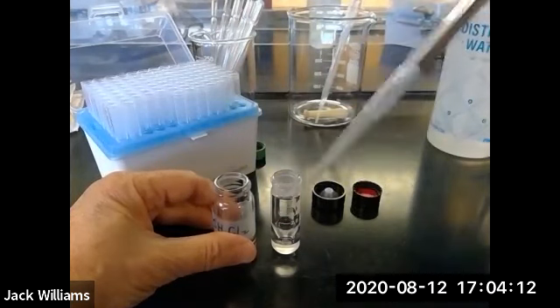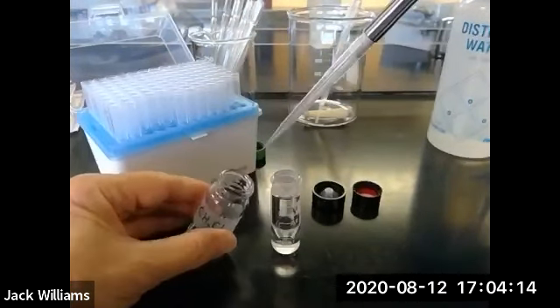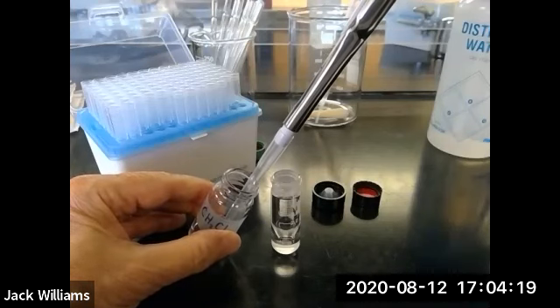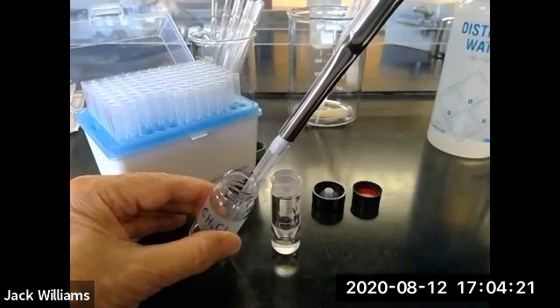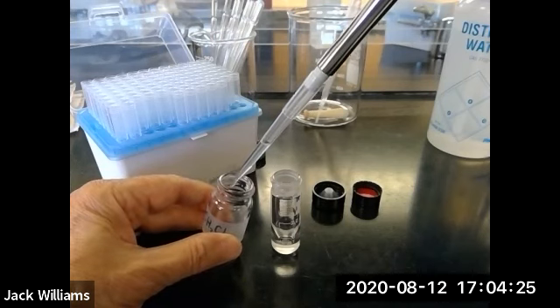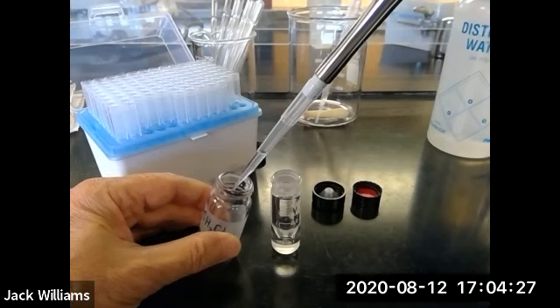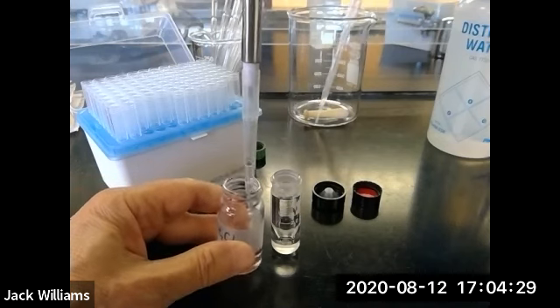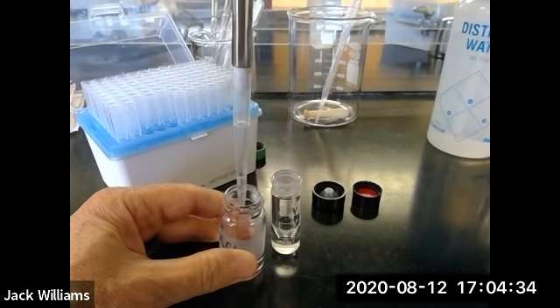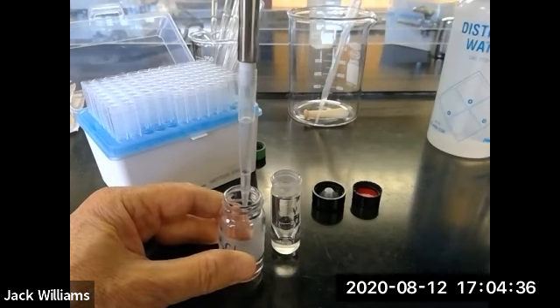So this is pretty volatile. The methylene dichloride, you'll notice that when you tip to the first stop into the liquid and withdraw, and now I'm going to take it, see how it drips out of there? So if I try and transfer like this, I'm going to spill it all over the table. Now notice that it's perpendicular to the table. I sent you a link to a little film on how to handle a pipette, so make sure you watch that.